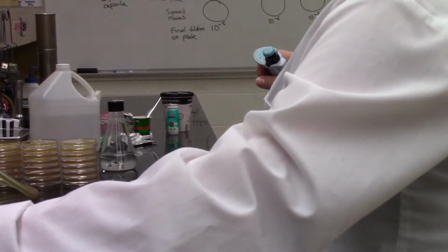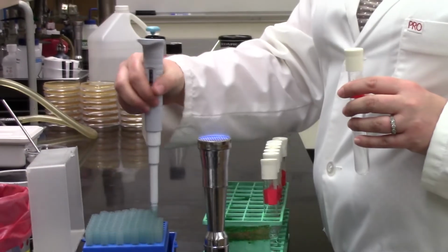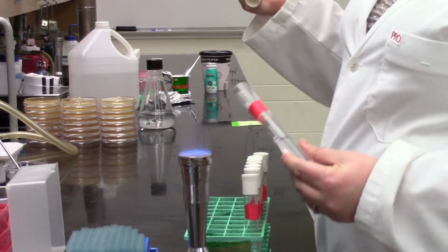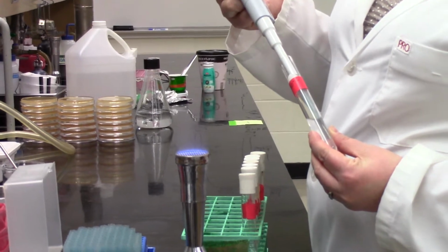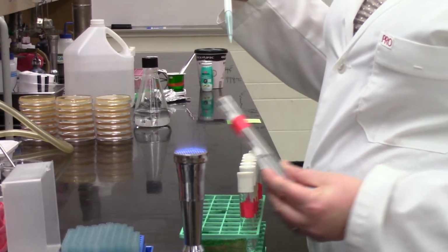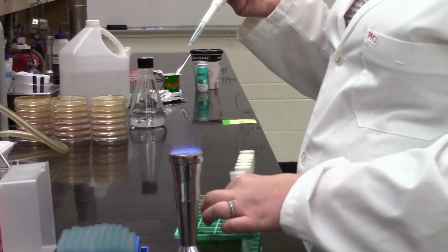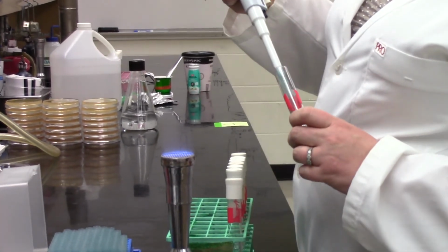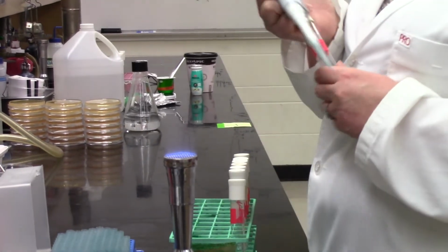And the next thing she's going to do, and this is going to get so repetitive, guys, is mix. So she's mixed again, just to make sure there's even distribution of those bacterial cells in that saline solution. Now she's using good aseptic technique, transferring another 100 microliters from that culture over into another 9.9 mils of saline. Because we were taking from a 10 to the minus 2 already, we've done another 100-fold dilution. We're at 10 to the minus 4.